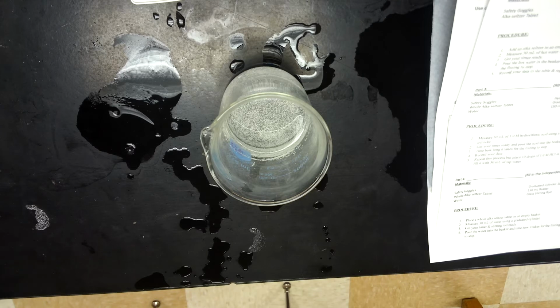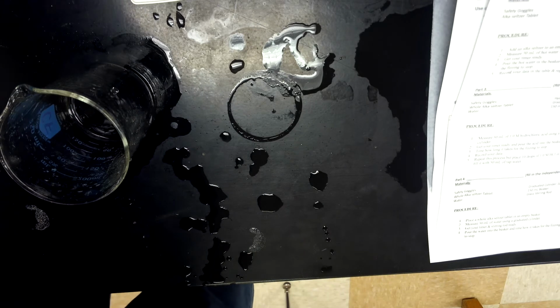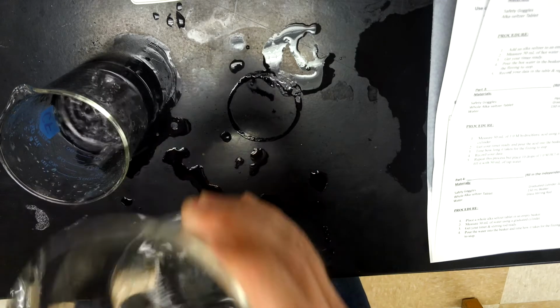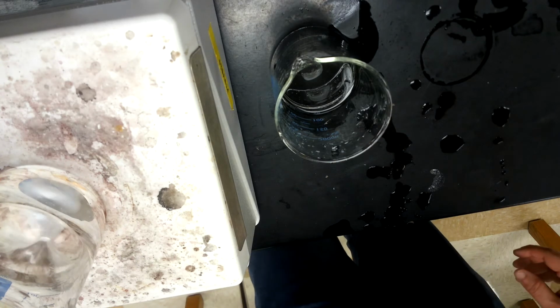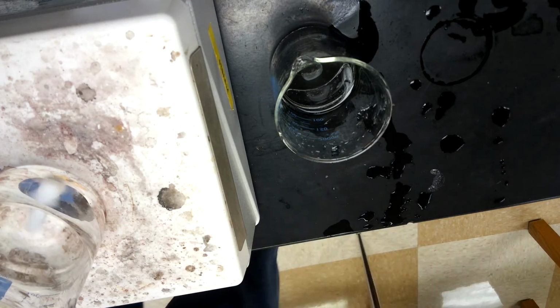Rinse out one of my beakers here and do our last one. Set this one to the side, which is just stirring. So this one I actually don't need to do a baseline, but I like to just because it's effervescence, and effervescence is fun for me. So if I move my camera a little bit, I hope you can see. Yeah, there we go. I actually am cheating. I have a stir plate here. So instead of me trying to stir it, which is funny for the students to watch, this thing's going to stir it for me. And let's get this one going.